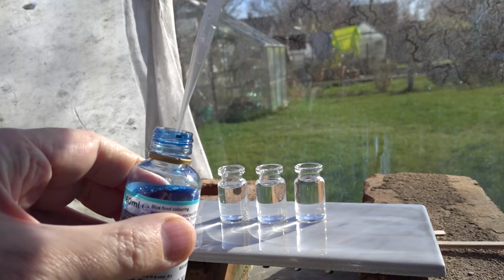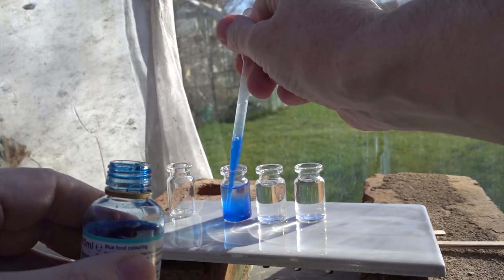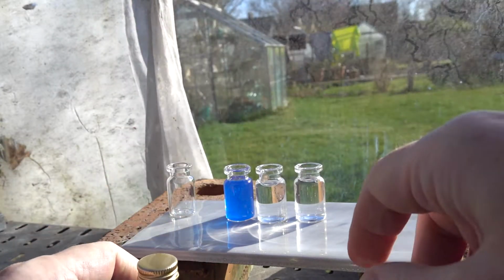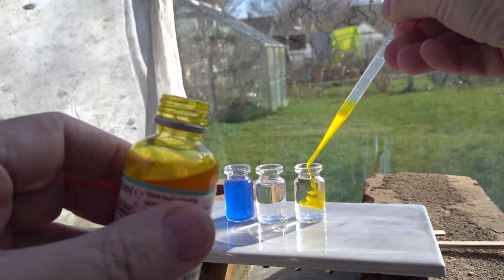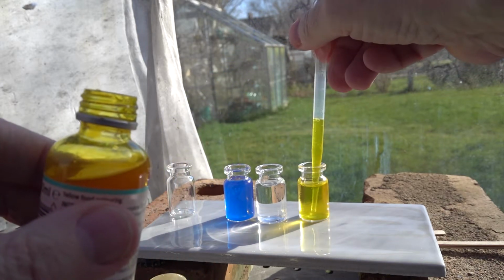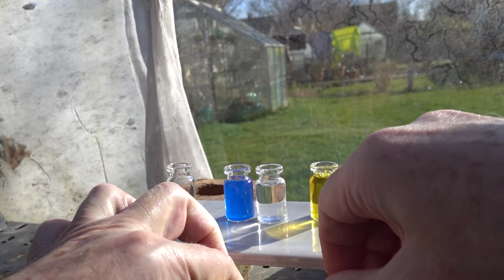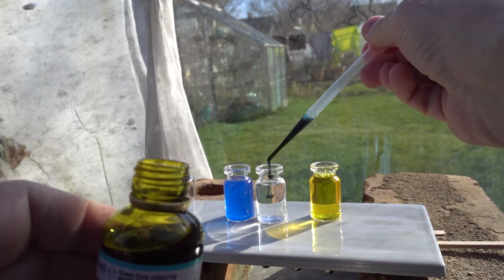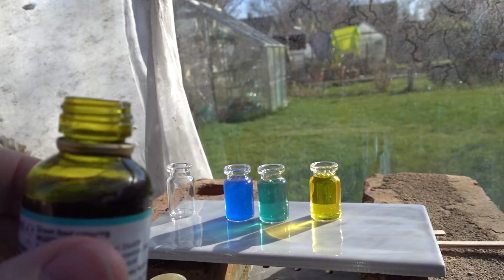Let's start with the spirulina extract for the blue. And we've got a nice blue colour there. Next, the yellow, from the curcumin. And finally, the green. Don't need quite so much of this one. So we've got three rather attractive natural colours.